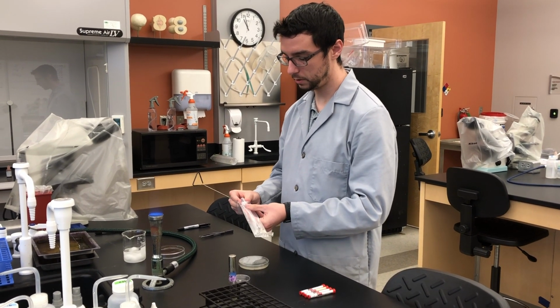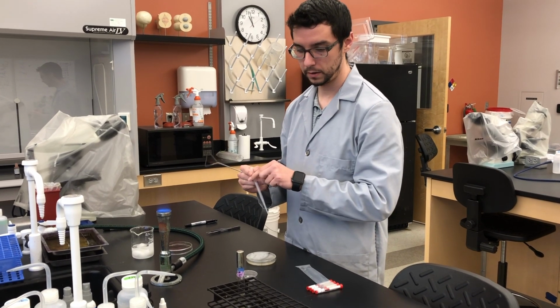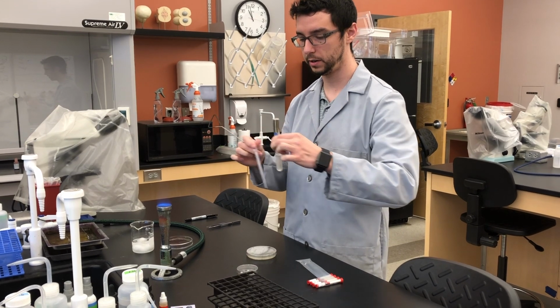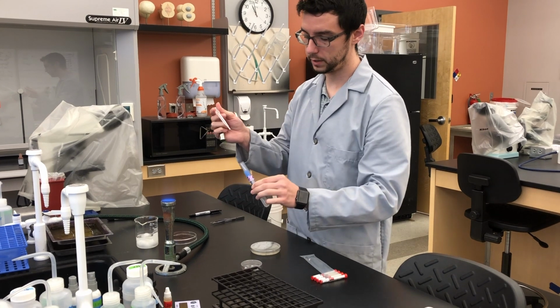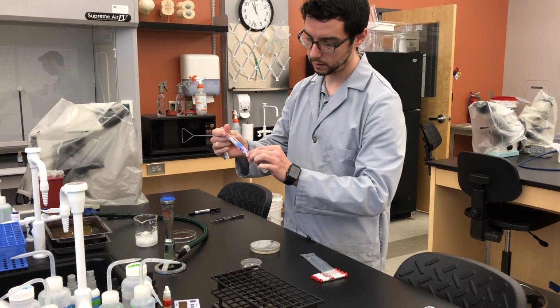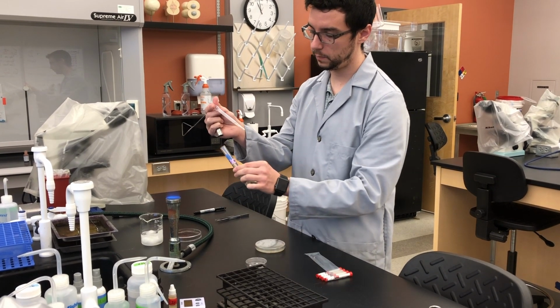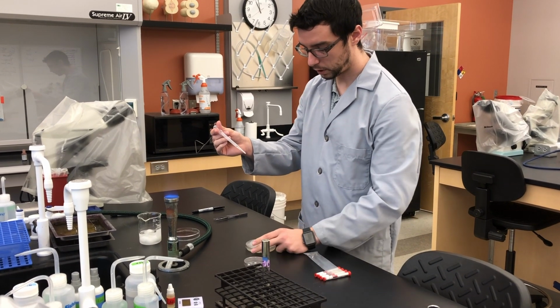Get the transfer pipette out, and then we're going to get our tube, flick it a little bit to get the culture around, open it up, wave the tube opening over the flame, collect a little bit of culture, wave it over flame, cap, and now you're done with the broth tube.